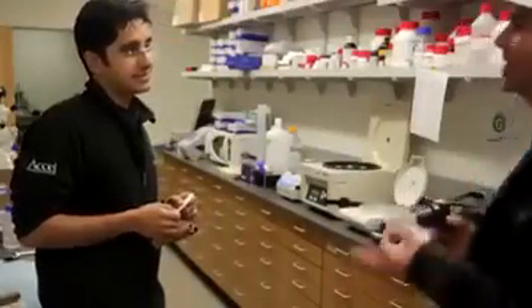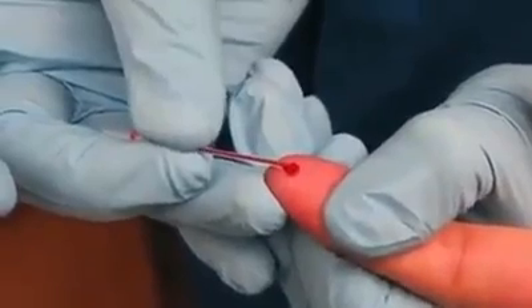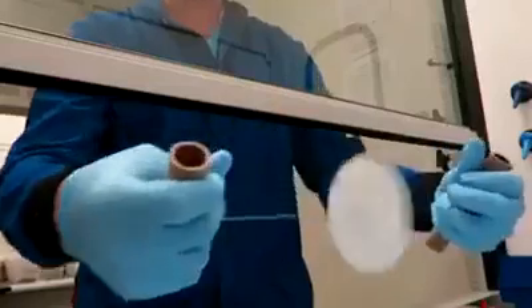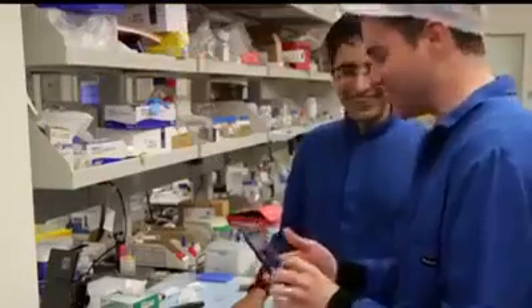So let's recreate that moment. We're going to take some blood and let's just spin it — we should take your blood. If you're spinning for only 10 seconds at 20,000 RPM, you can see my blood was already separating. This is my own blood — I've never seen my blood at this level before. That is crazy. So each one of those is a blood cell? Wow.